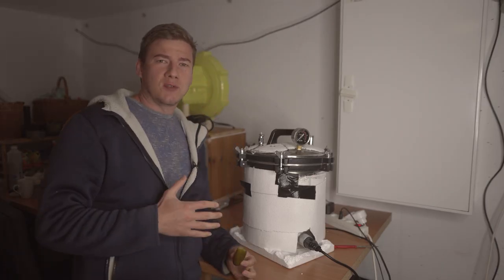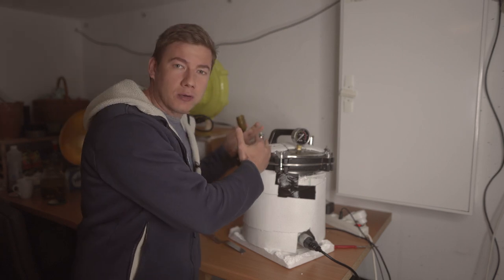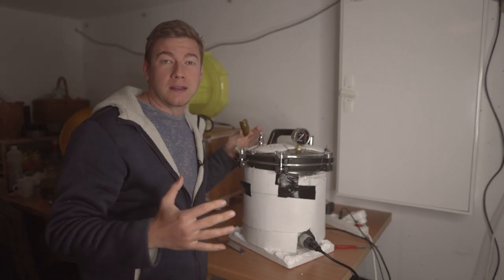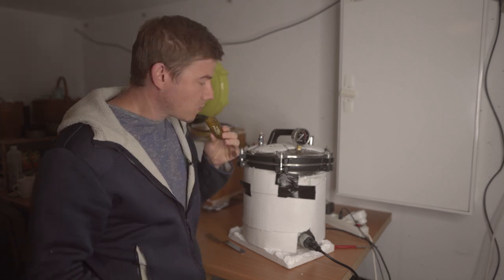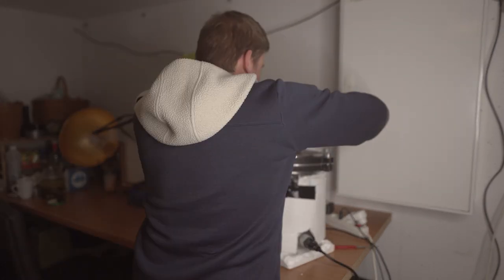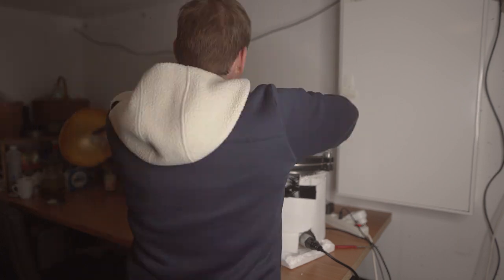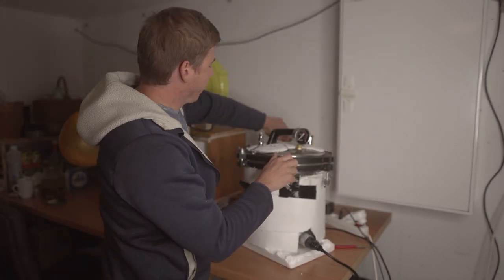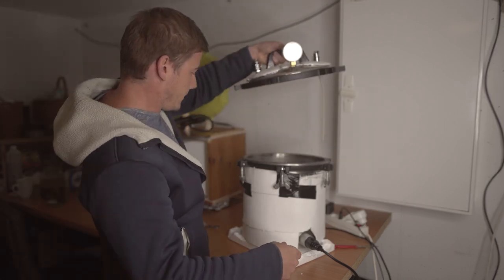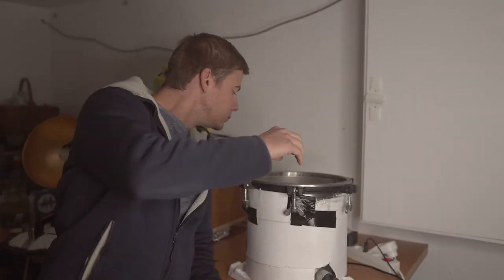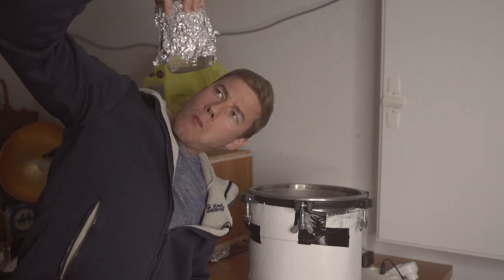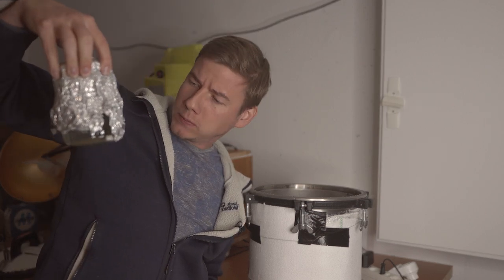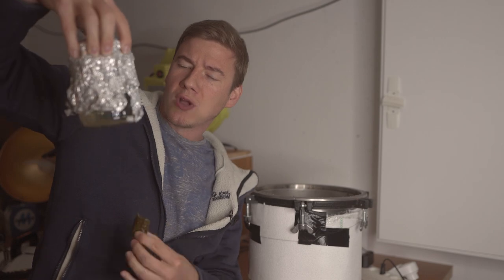Okay, the pressure cooker had time to cool down, so we want to open up the autoclave and then inoculate the liquid honey solution with some mycelium. Let's go. It looks pretty good. It's time to add some mycelium.